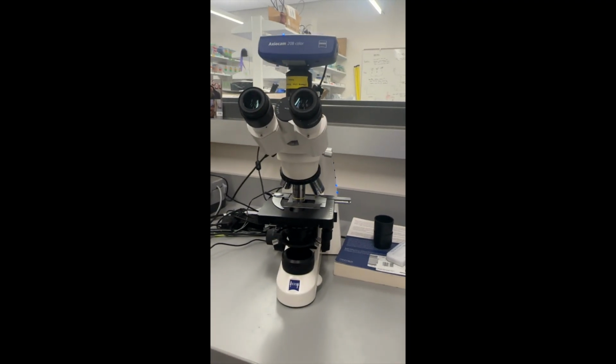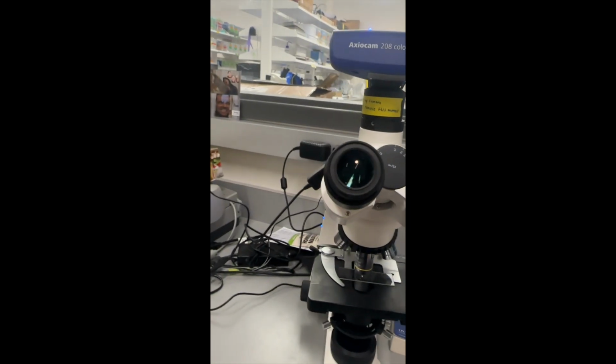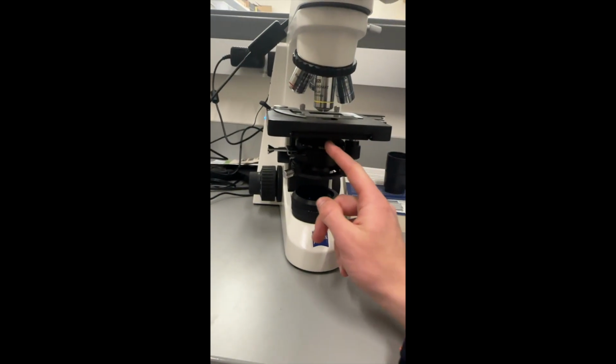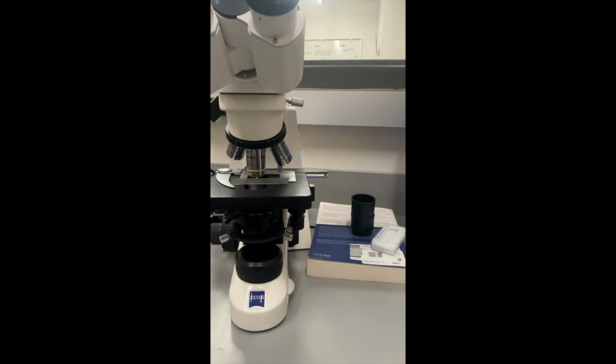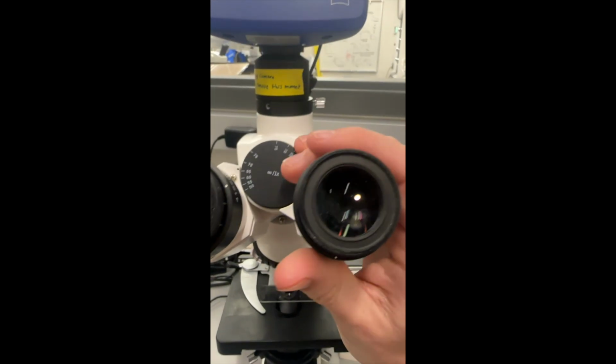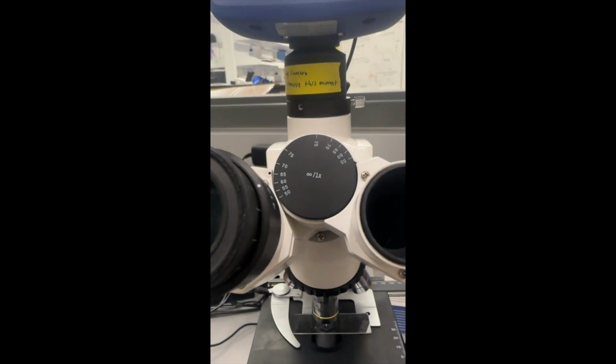Okay, for the very last step, it's kind of cool. You get to take apart your microscope for this one. So what we're going to do is we have our aperture lever down here, all the way to the left, which means it's all the way open. All the light is currently coming in through the eye ports. So what we're going to do is we're going to take off one of the eyepieces, which I can't seem to do with one hand. So bang, boom, eyepiece removed. And we're going to shove you down in there, get a good look at that.